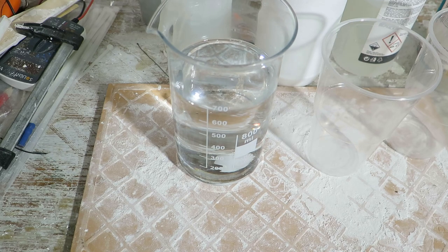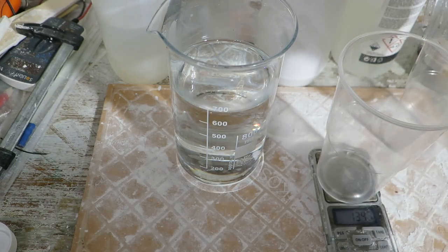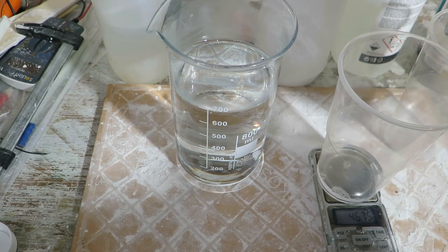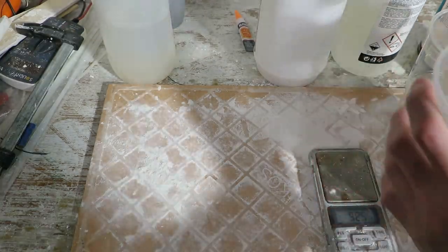Ok, so first step, make silica gel. So for this batch I started by pouring 700 milliliters of water into beaker. Then I measure as precisely as possible 46.7 grams of sodium silicate in plastic cup. And mix sodium silicate with about half of the water that you have in the beaker.